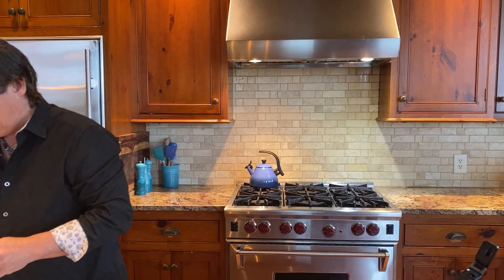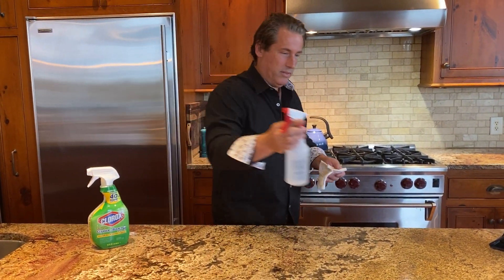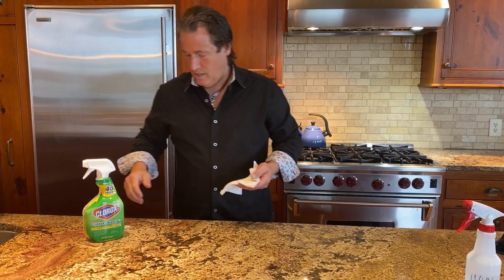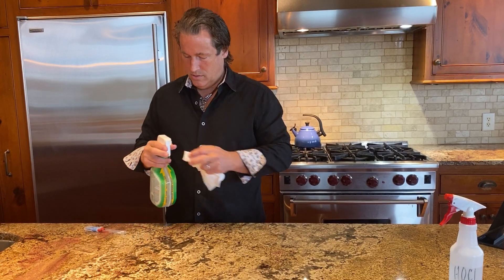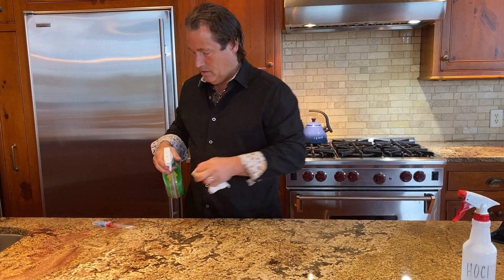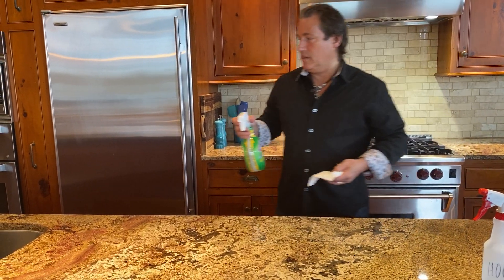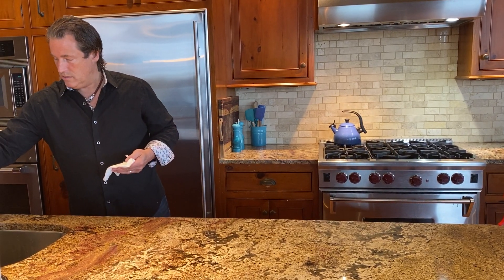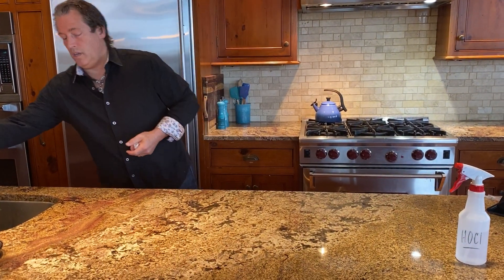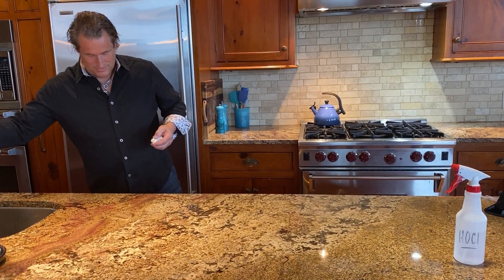We did it! So now over here, I'm going to test for some big cleaning companies that were wondering. Now we will do bleach — just your Clorox with bleach that you buy at the store. How long are you going to let that sit? They said to let it sit about 20 to 30 seconds, so I'll let it sit about 20 or 30 seconds. Better put a little more on there. Oh wow — bleach, it kills your lungs.